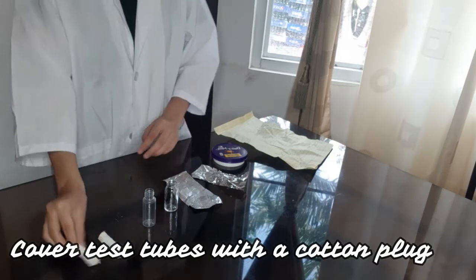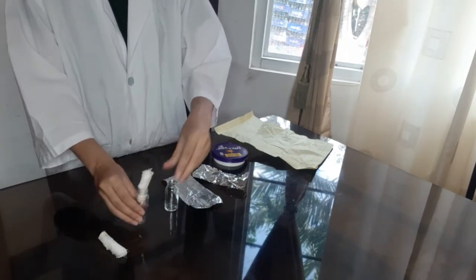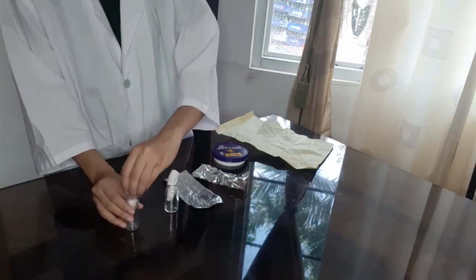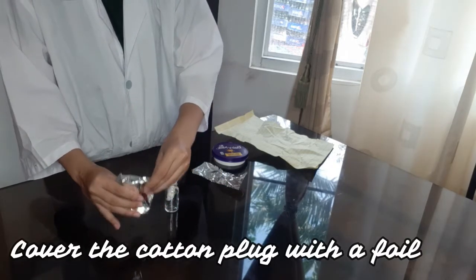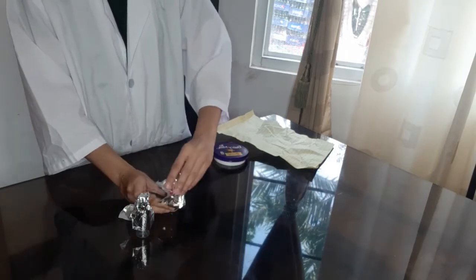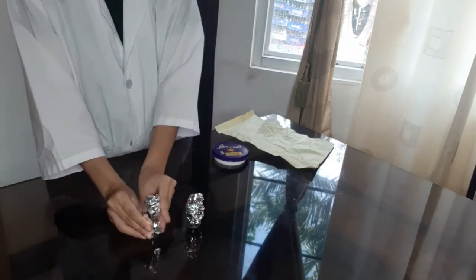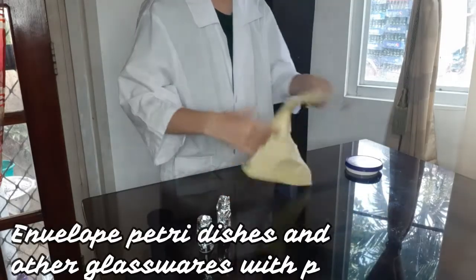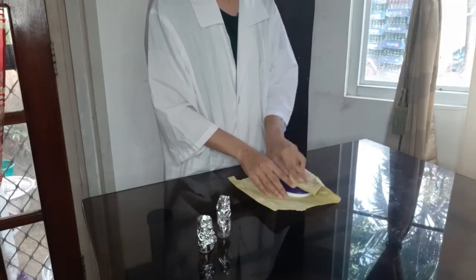After washing the glasswares, cover test tubes with a cotton plug and cover the cotton plug with foil to avoid contamination during sterilization. Envelope petri dishes and other glasswares with paper to avoid breakage during sterilization.